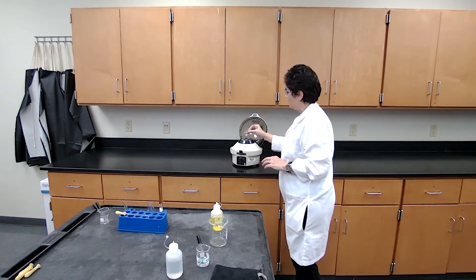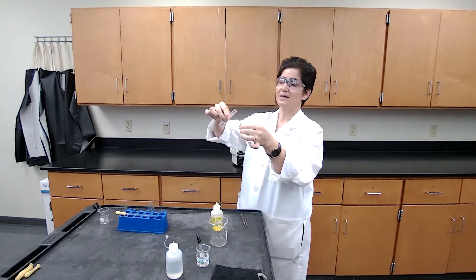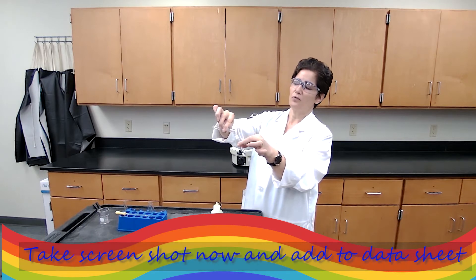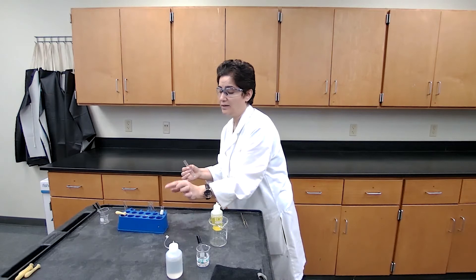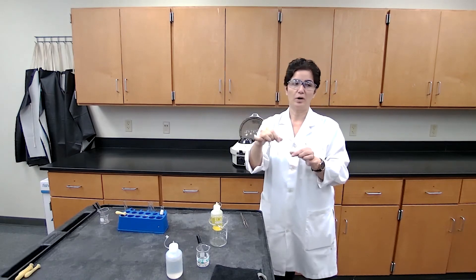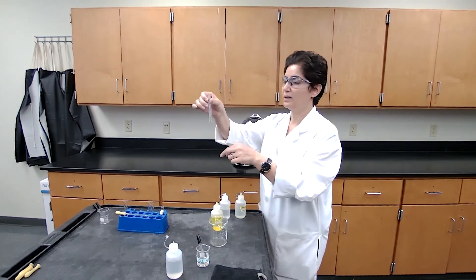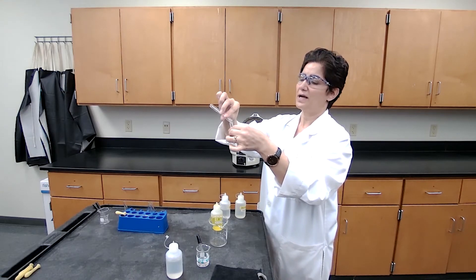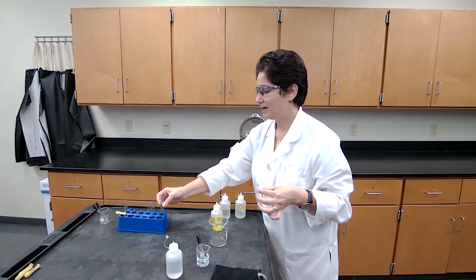The centrifuge is done. We take the test tube out. This time we are keeping the centrifugate because the liquid is going to contain lead ions. We place it in a test tube — for best practice, label the test tube with 'lead' so you know which one it is. Then, based on the procedure, we add hot water again to what is left and centrifuge one more time, collecting the centrifugate into the same lead test tube.